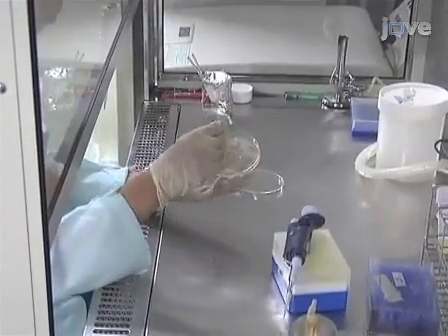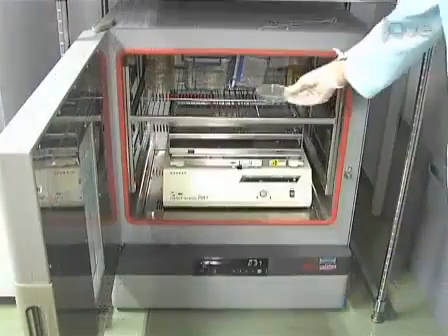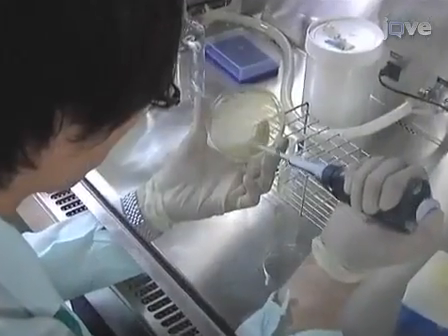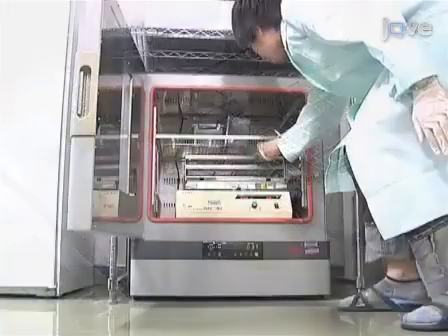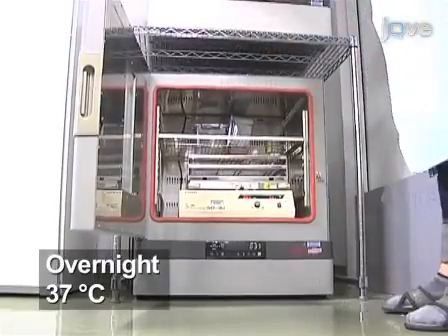Using a sterile glass spreader, streak the fluorescent bacteria on an LB agar plate and incubate the plate at 37 degrees Celsius until single colonies are visible. Pick a single colony off the solid agar and inoculate it into 2 milliliters of fresh LB medium, then culture the bacteria on a shaker overnight at 37 degrees Celsius.